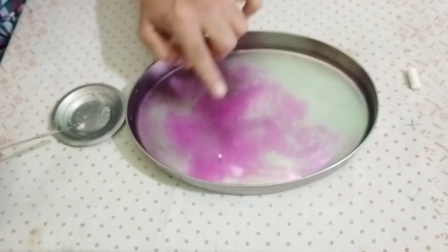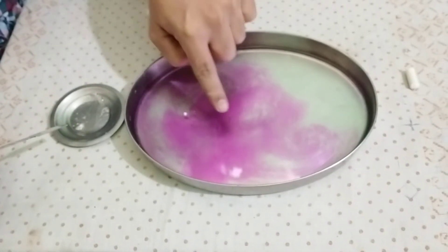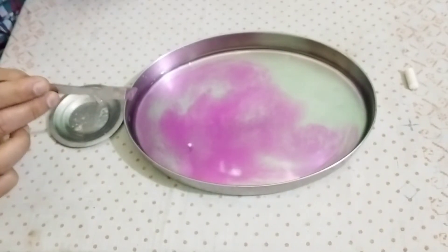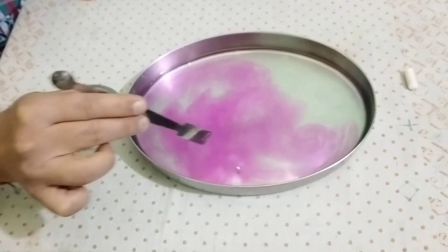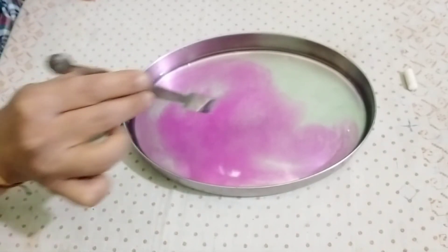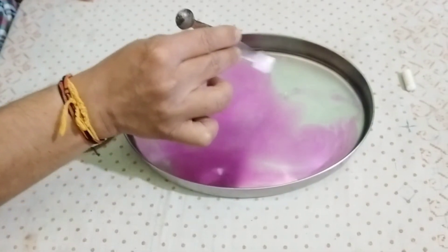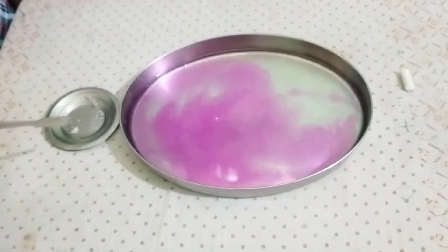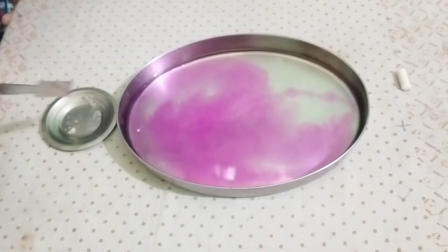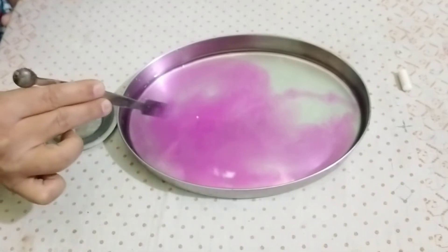Wherever this sodium metal goes, you can see the formation of pink color and the liberation of hydrogen gas. I hope you are able to see this. It has formed a silvery globule and it is moving on the surface. Observe very carefully, children — see, it is here, it is moving.